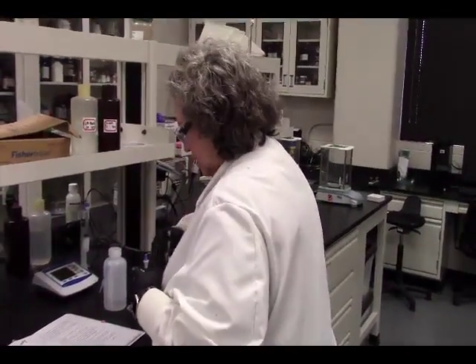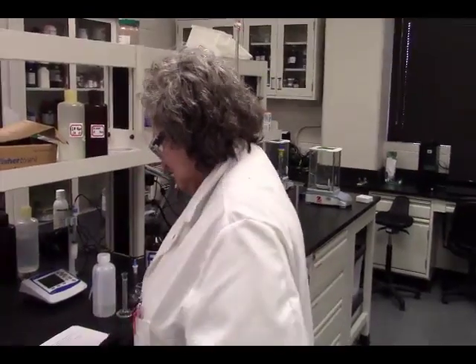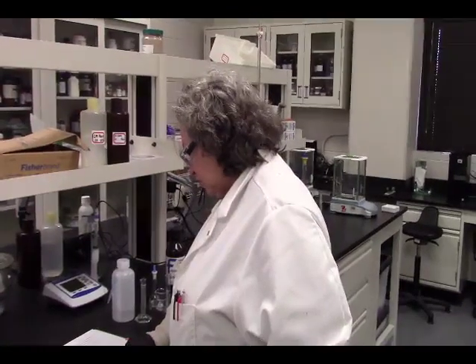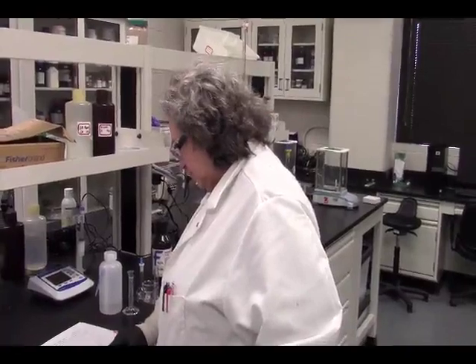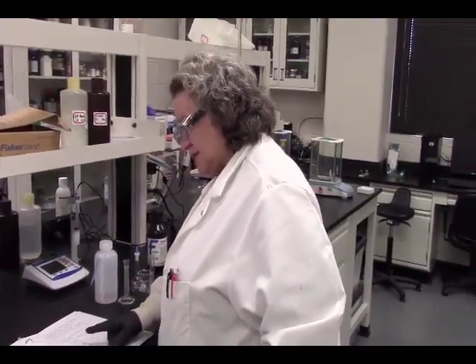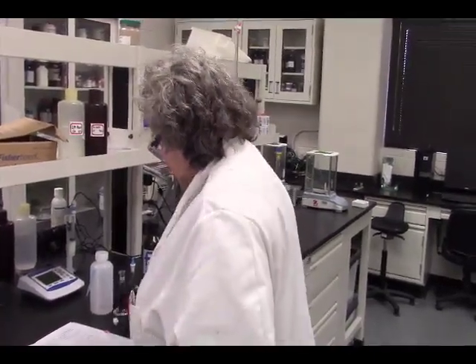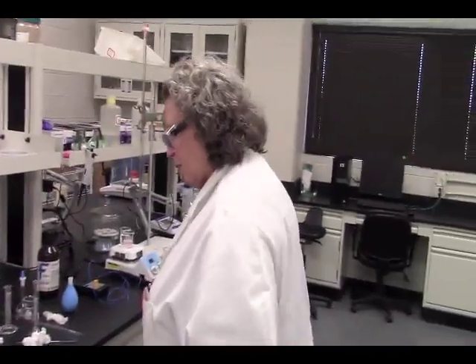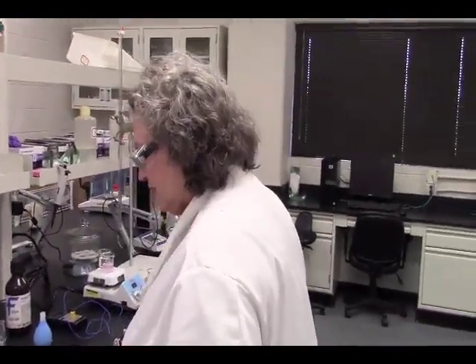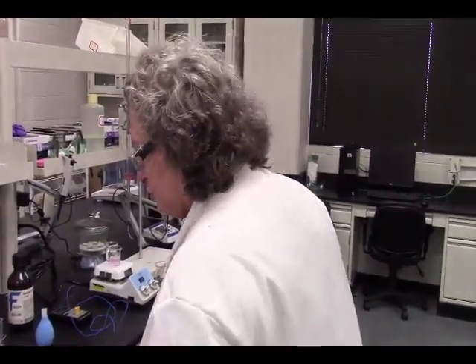Now we need, okay, steps 5 and 6 for this have to be done quickly. So we're going to have to move quickly. If I don't talk a lot, forgive me, but this has to be done pretty quickly. It's suggesting that I gather all the necessary materials before I even start on this. So let's do this. We need 0.6 grams of cobalt 2 nitrate hexahydrate, 10 milliliters of water, and 2 to 3 drops of 30% hydrogen peroxide.